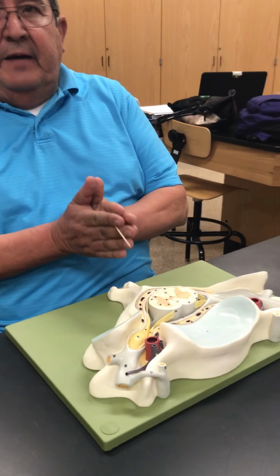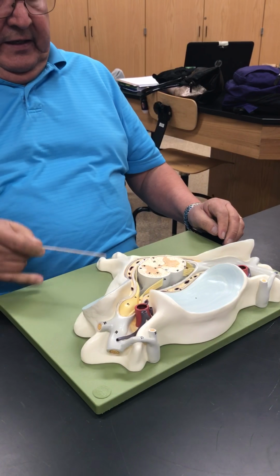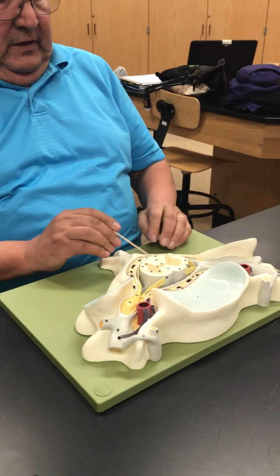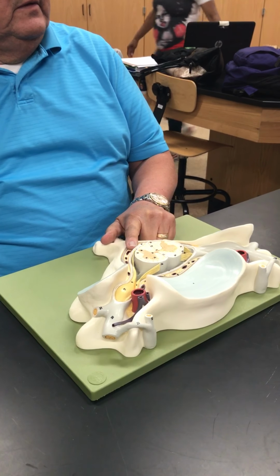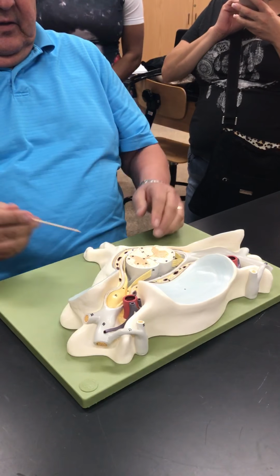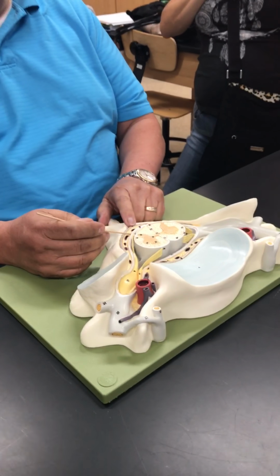Oriented myself, I'm posterior. Got it? If I take a needle and stick it in here, this layer right here is the dura mater, which means the hard mother. Think of a taco. I've got shell on this side and this side. Well, I've got dura mater here and here. And in between, I've got all this fat, adipose tissue.